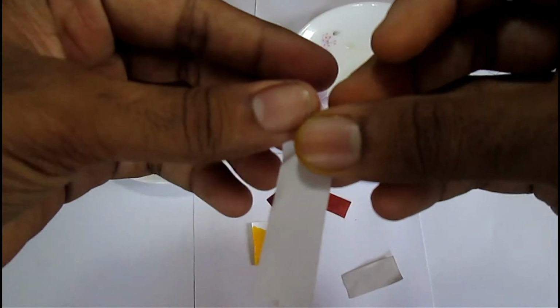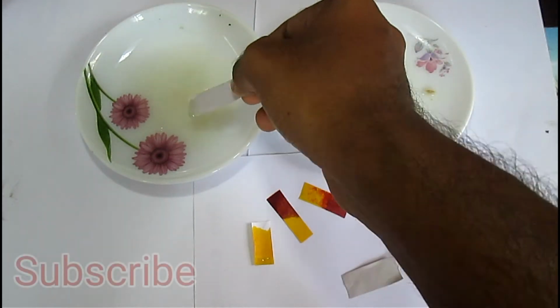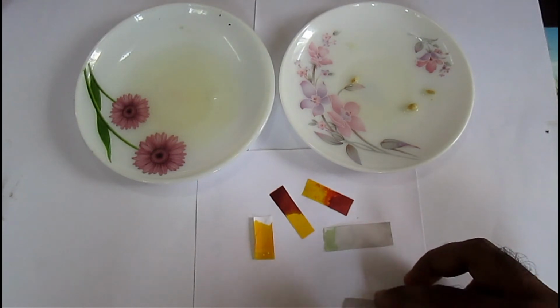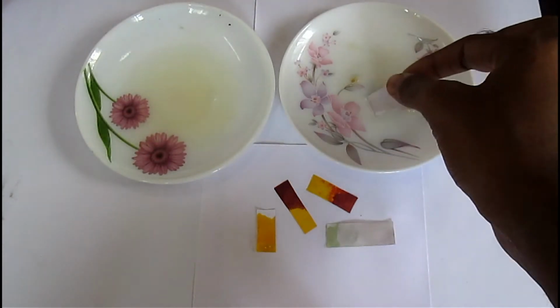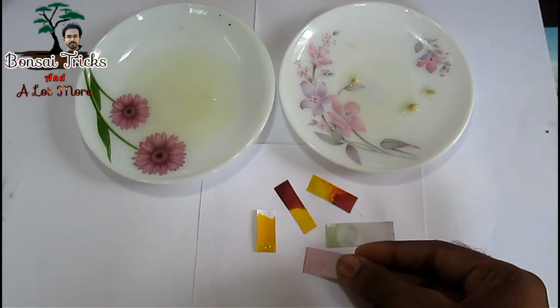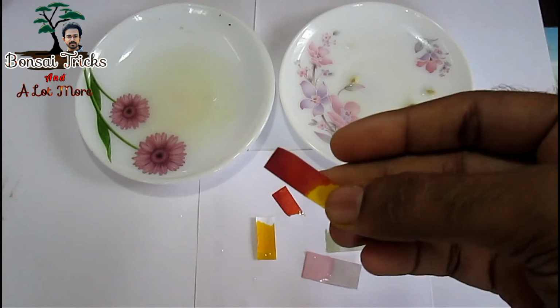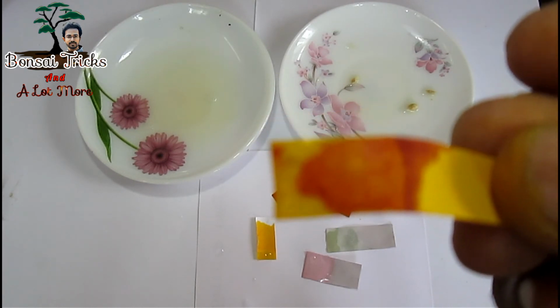Now let's test our rose paper too. This is the rose paper we have made earlier. Let's soak it into basic solution. Can you see the color is turning into green? And now let's soak the paper into acidic solution. Can you see the color of the paper is turning into pink? Isn't it amazing? We can make such wonderful pH strip or pH indicator at home. So why should we buy our costly litmus paper? We can easily make this in our home.